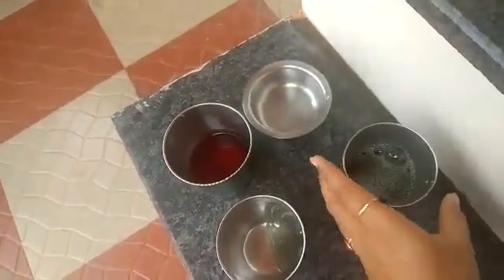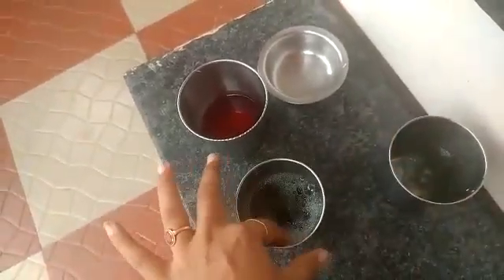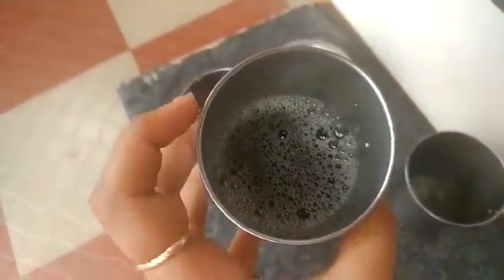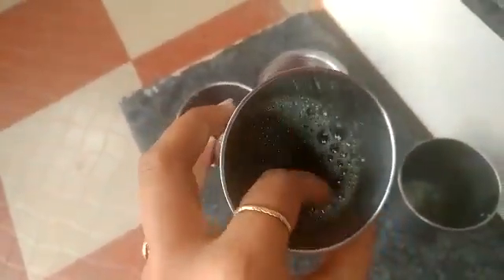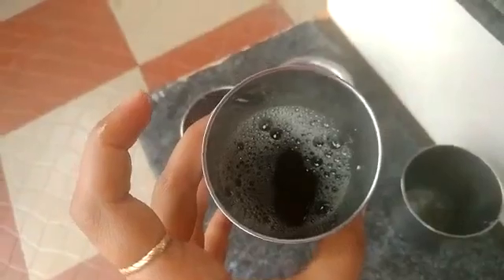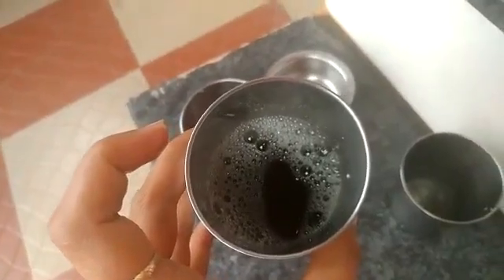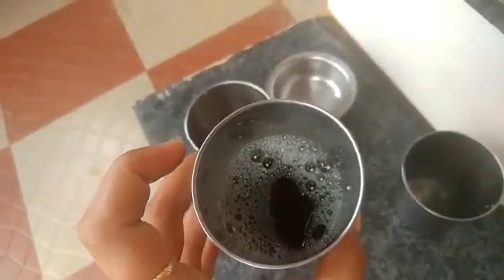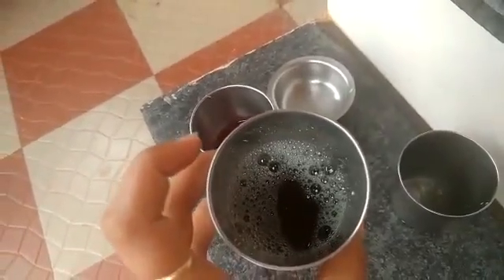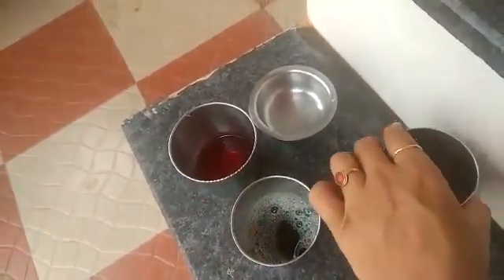Now let me pour the soap solution to observe the change in color. You can see the bubbles, and the color has turned to somewhat greenish. Initially it was the maroon color of the China rose solution, but after adding the basic soap solution, it has turned to greenish.